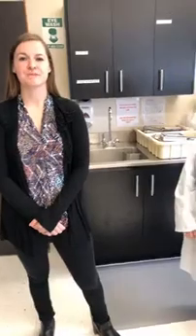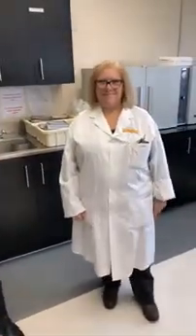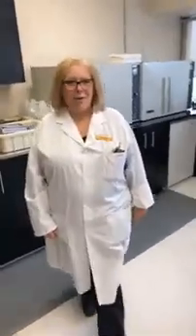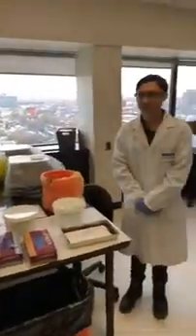We're going to kick things off here in the Medical Laboratory Science program on the 14th floor. To start off the tour, I'm going to hand things over to our faculty member and students here. I'm Laurie Ashley and I'm a professor here in the Med Lab program. We're currently in the histology area and I'm going to pass you on to our students who are going to tell you what we do in histology.